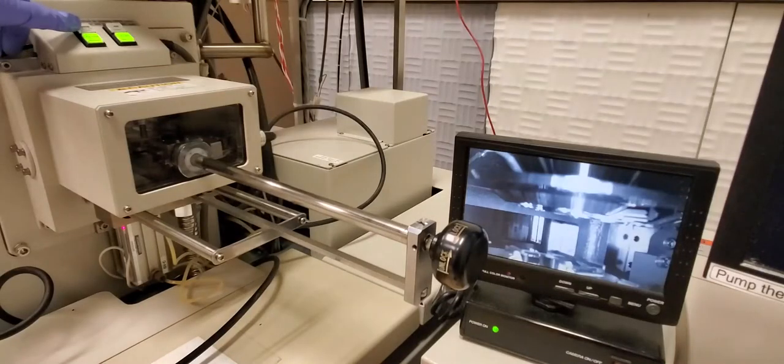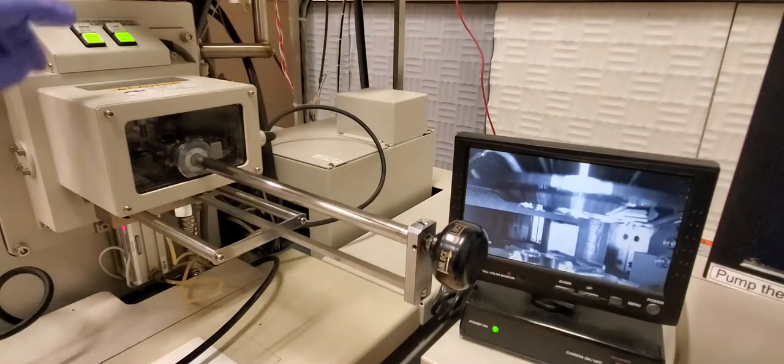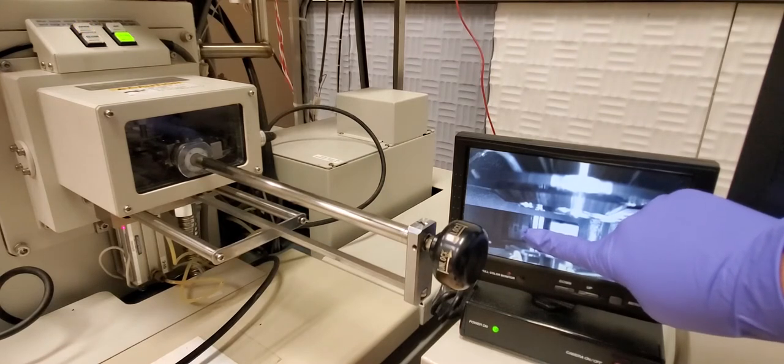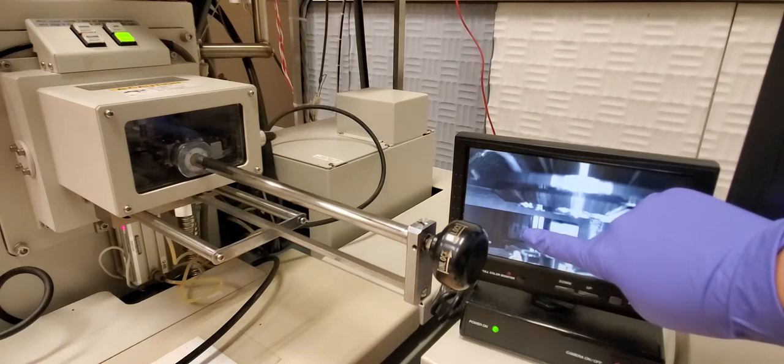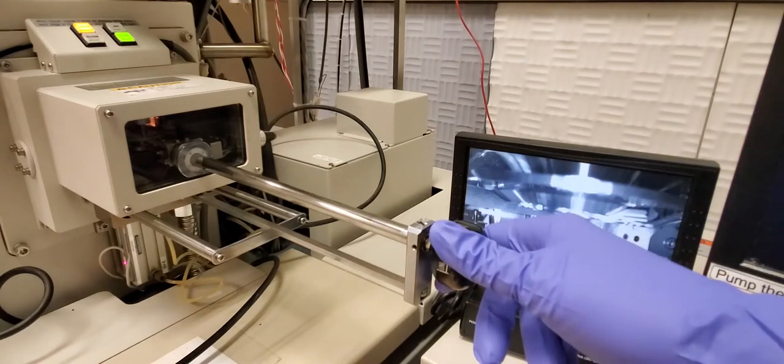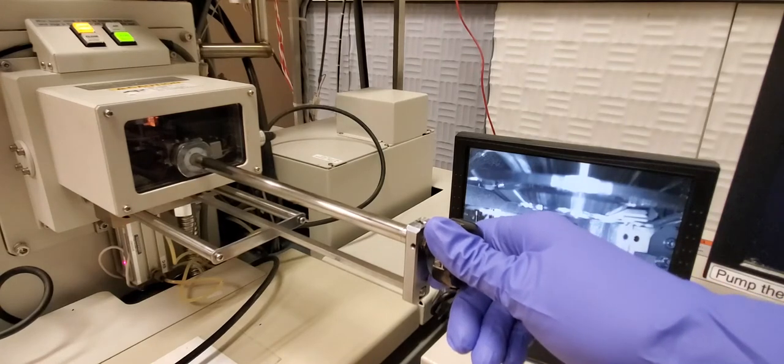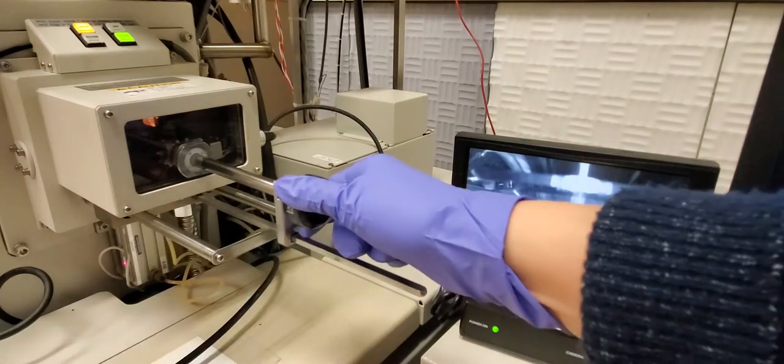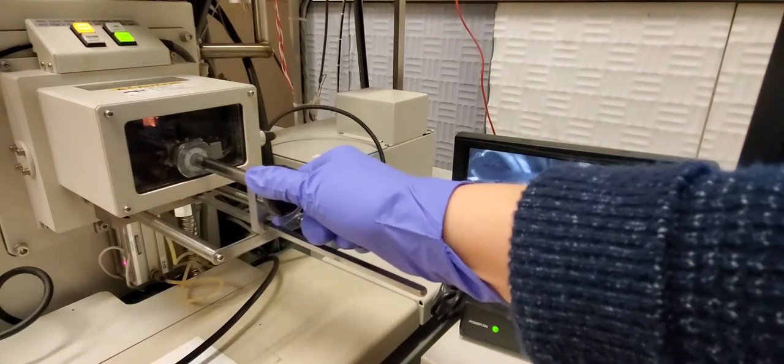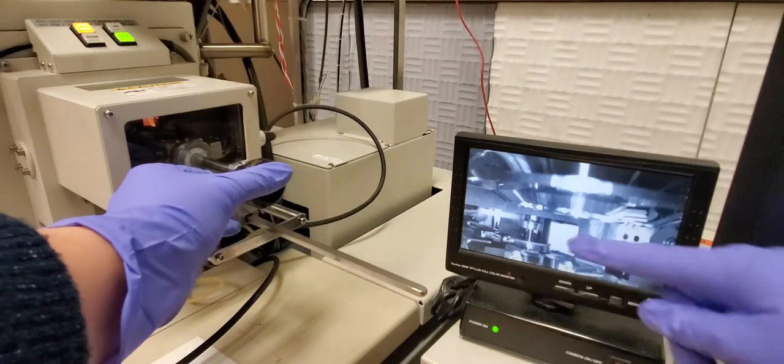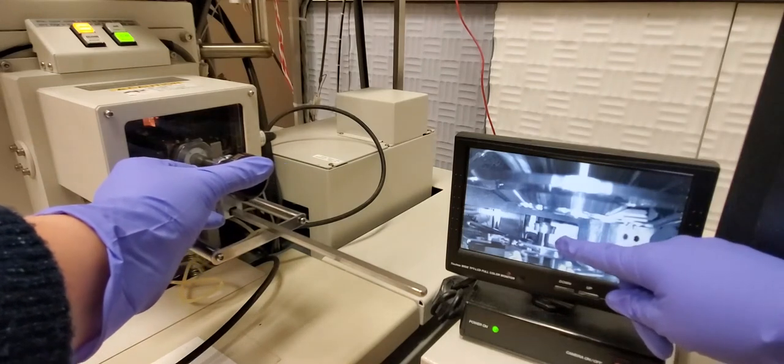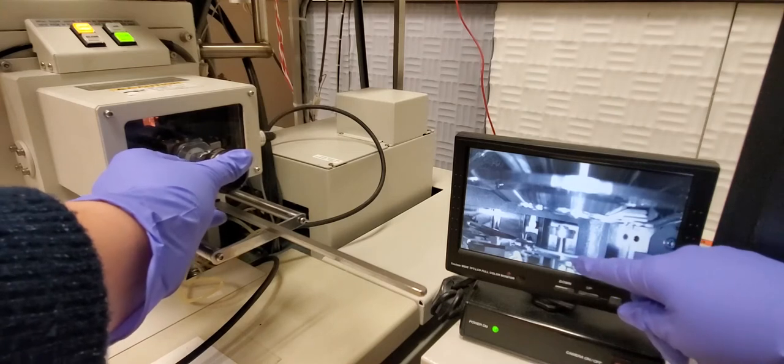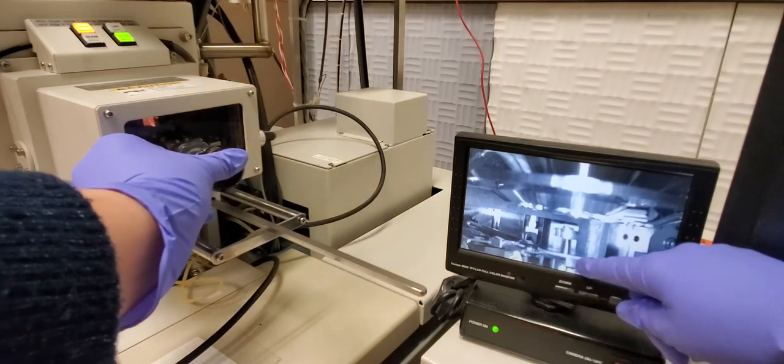So once it's done, we can press the open and wait. You can look at the infrared monitor here. Wait for the door to open. So now we can push the rod in. Do not bend the rod in any direction. We only push straight. Keep a grip on it so that it doesn't pull in too fast. And we're going to make sure we don't hit the pole piece here. And make sure you push it in all the way so that it's definitely on the stage.